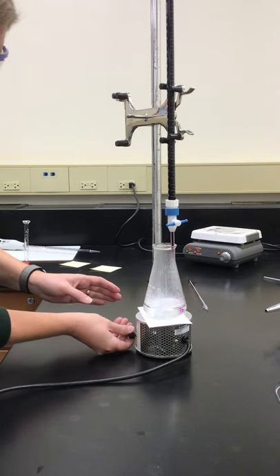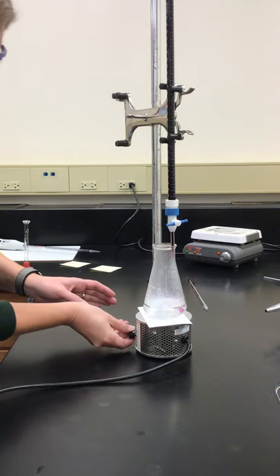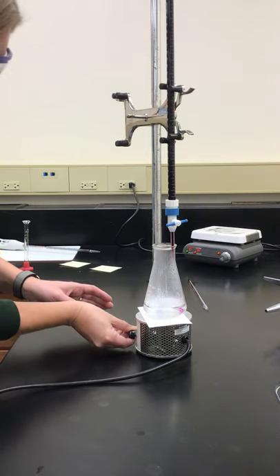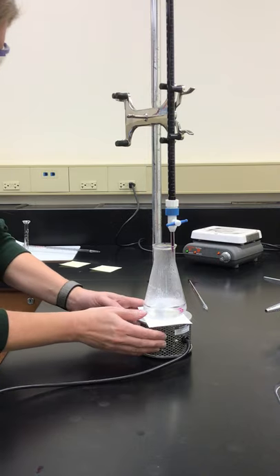There's our stirring. I'm just going to have it slowly stir for me, a nice gentle stir.